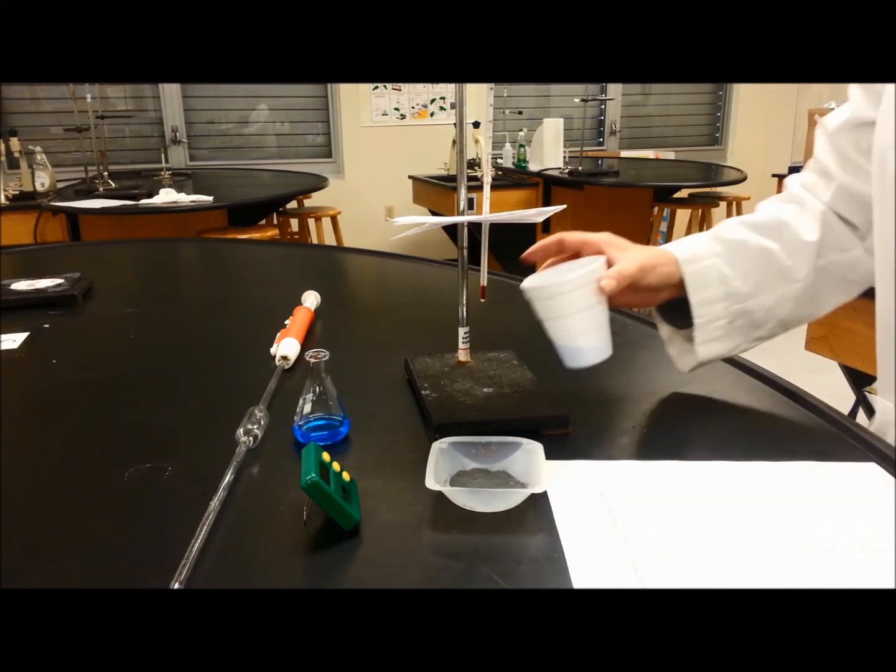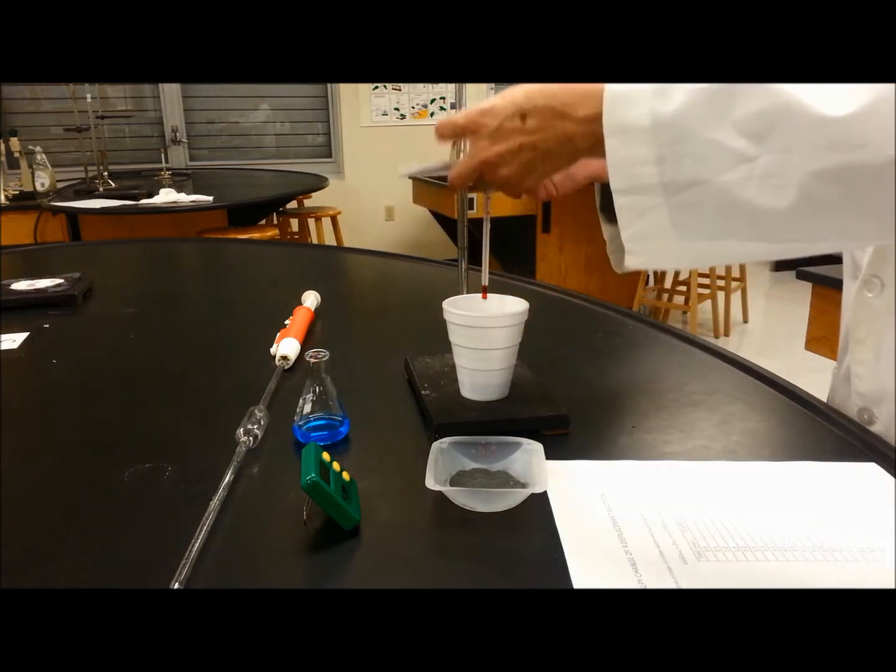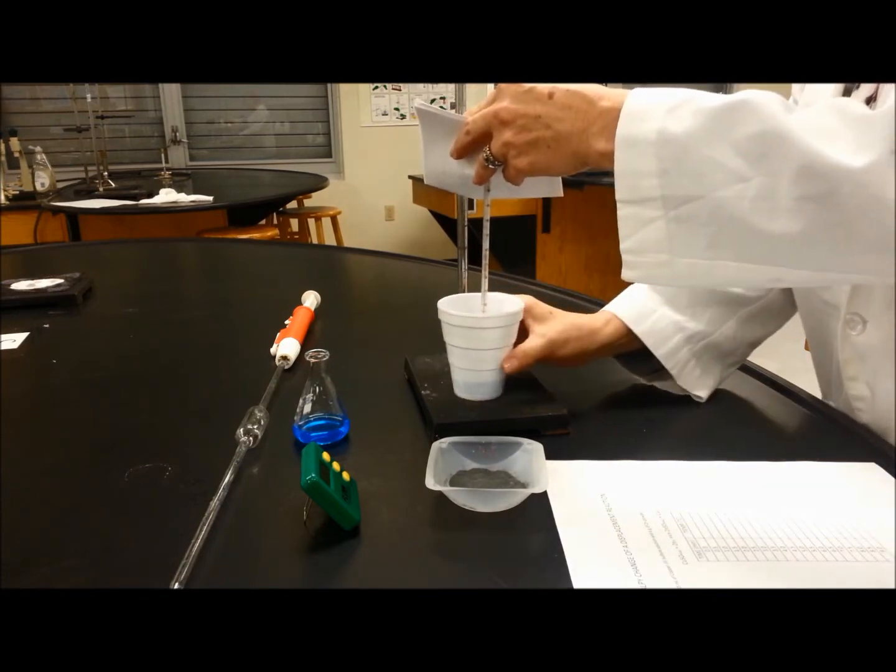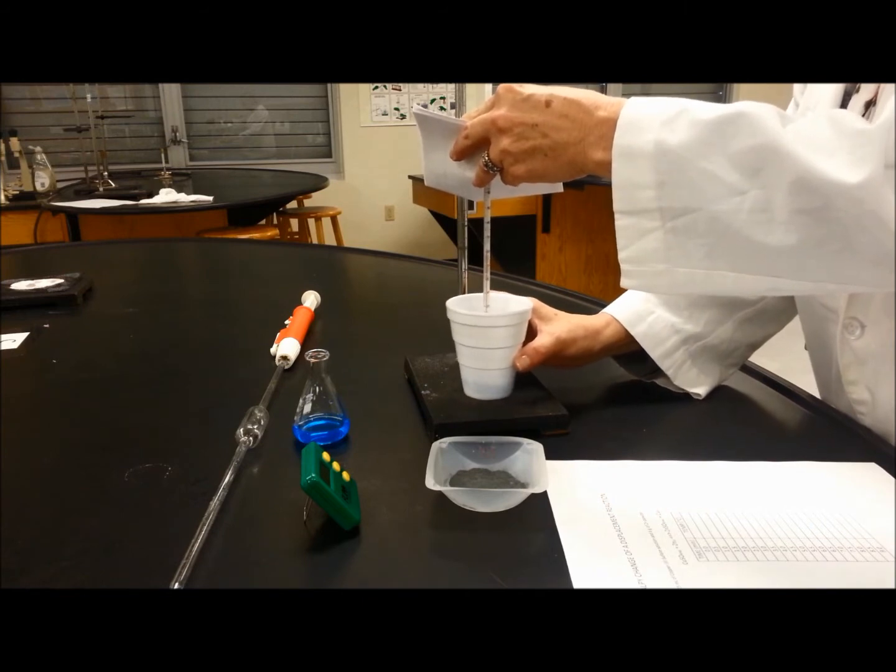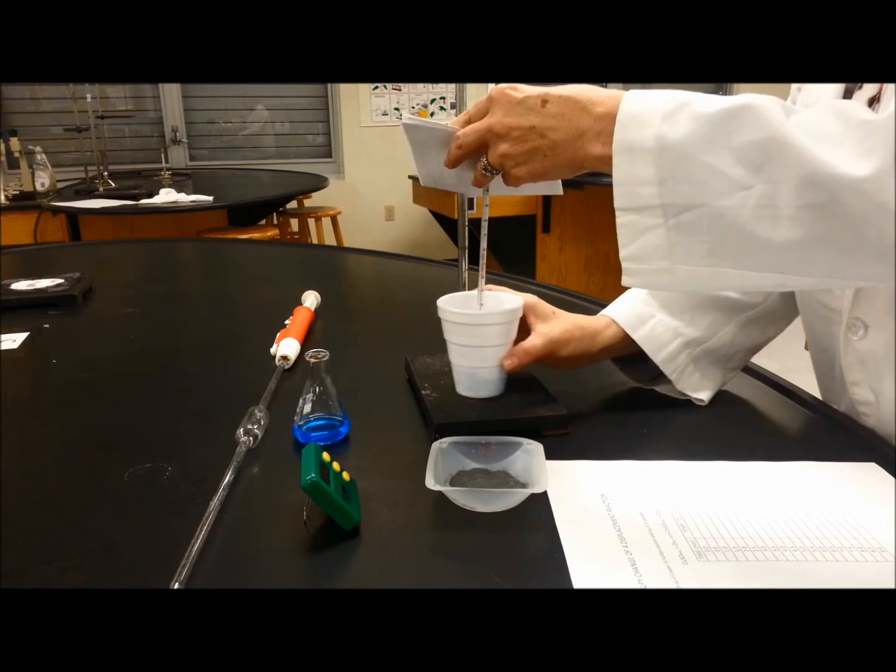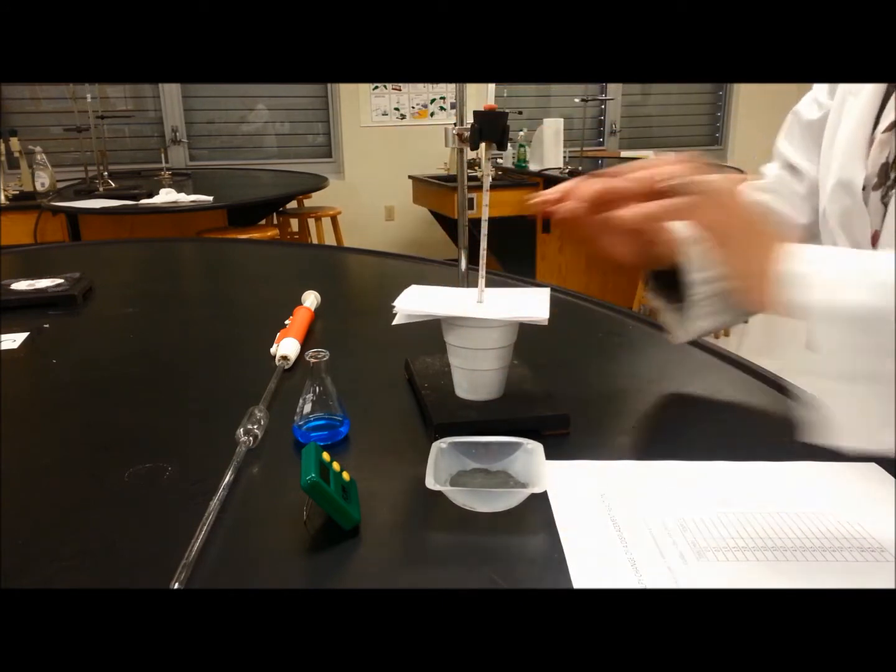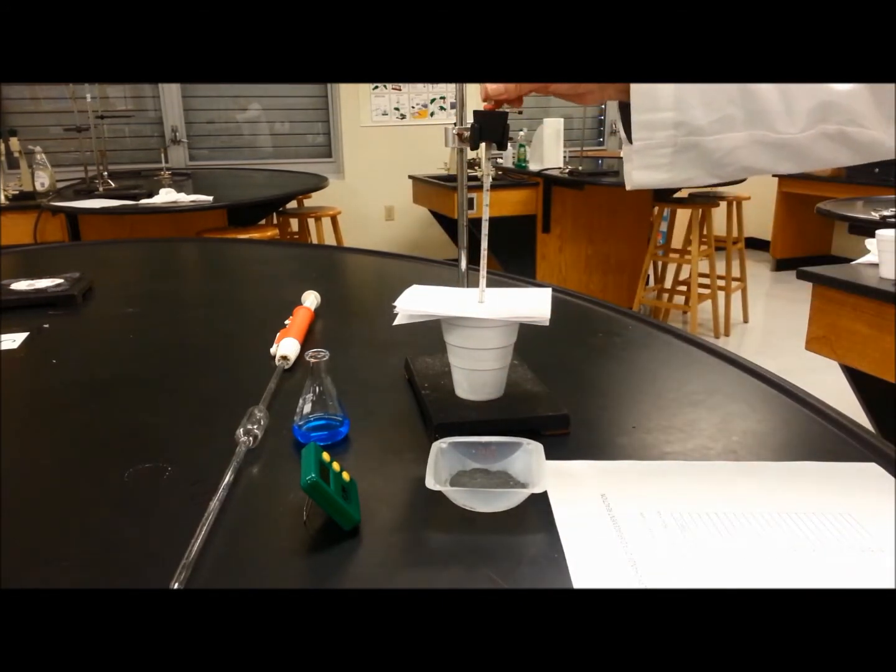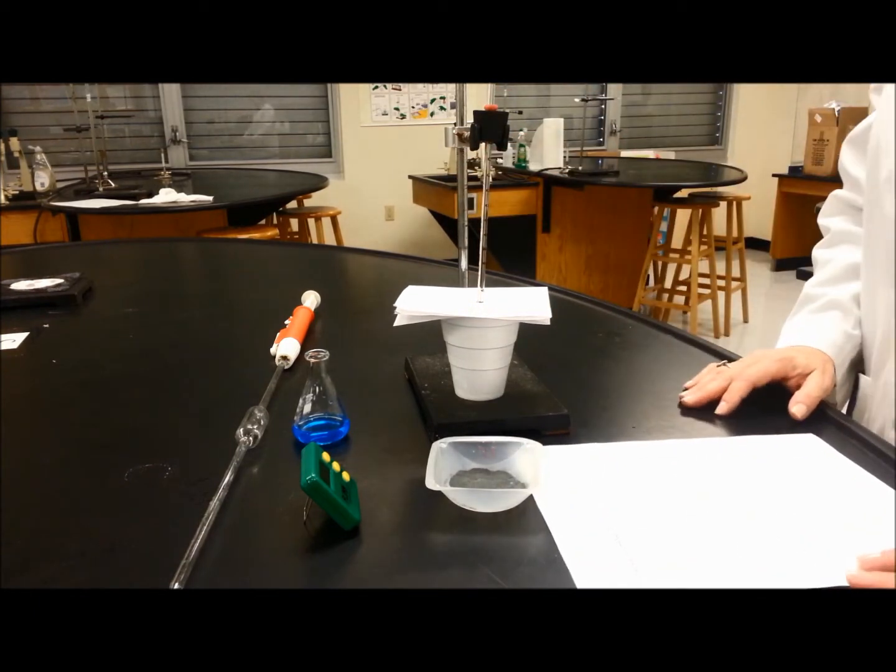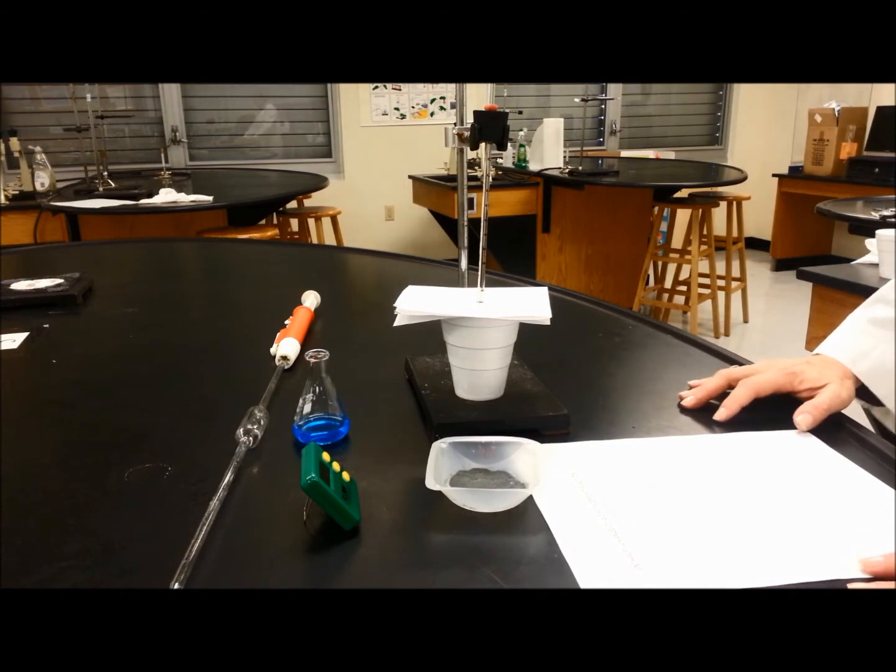Then we are going to measure which is the correct height for the thermometer, so I can move it but the bulb is inside the liquid. And then we wait for the temperature and begin recording.